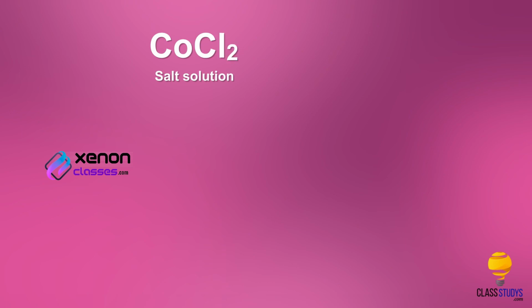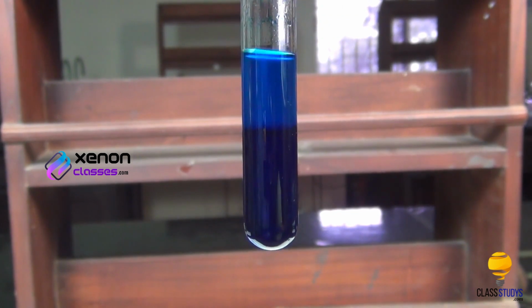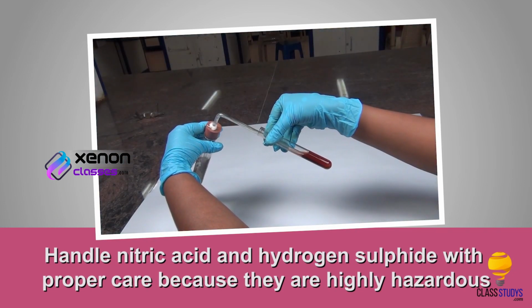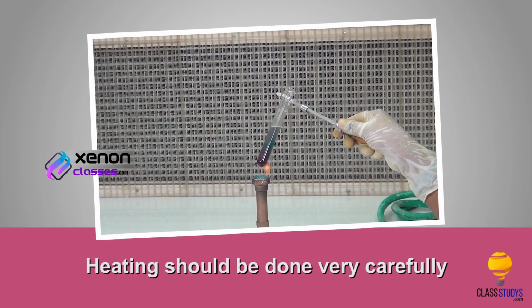Cobalt ions present in the salt solution react with ammonium thiocyanate to form ammonium tetrathiocyanatocobaltate 2, which gives blue color to the ethereal layer. Precautions: Handle nitric acid and hydrogen sulfide with proper care because they are highly hazardous. Heating should be done very carefully.